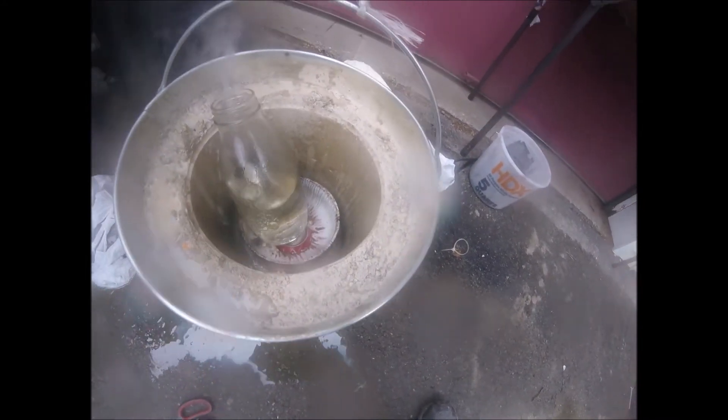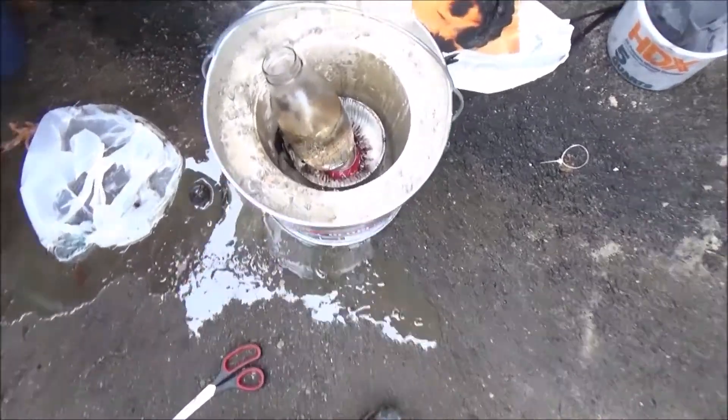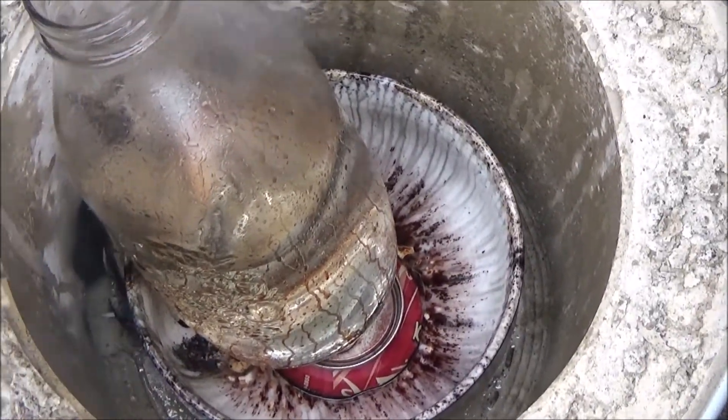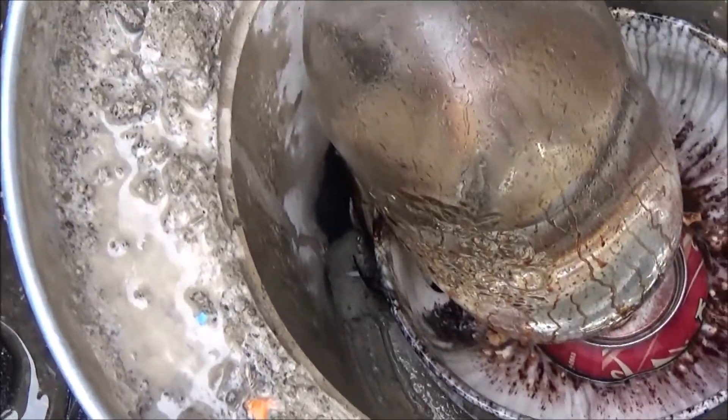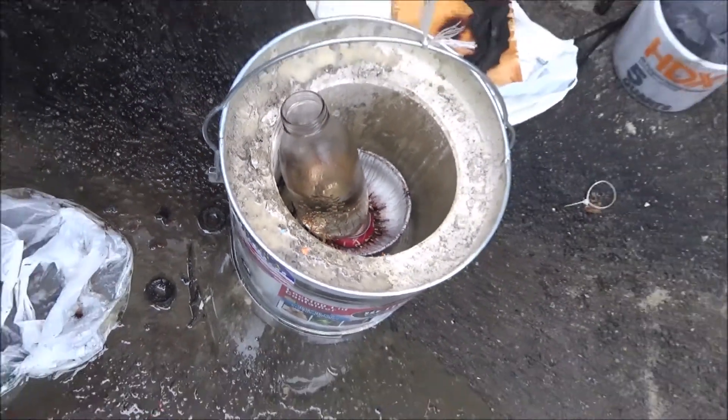Where is all the oil in the cup? Something happened — it didn't really work, but it didn't lose the acid, so pretty cool.